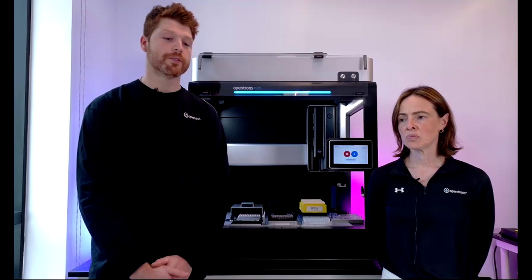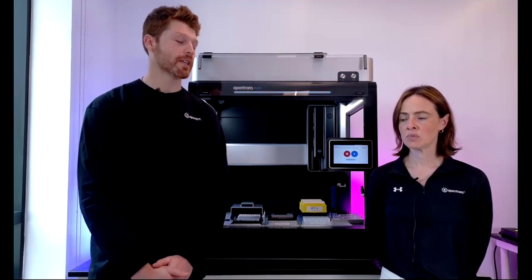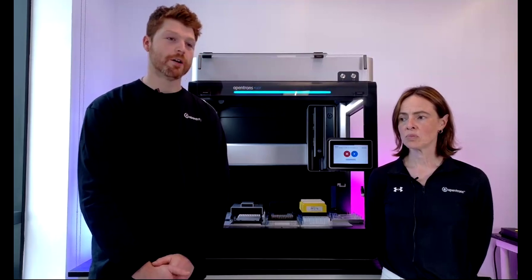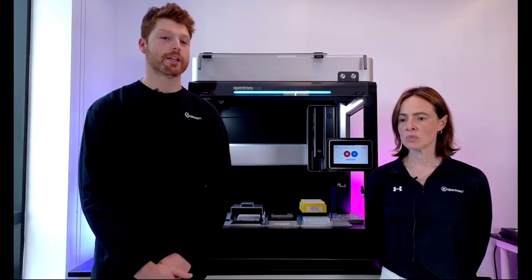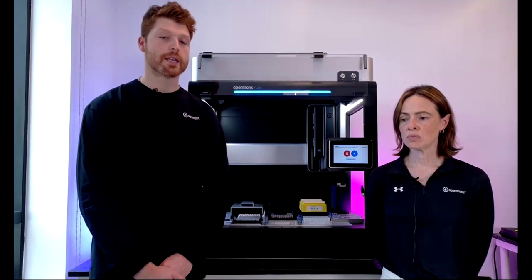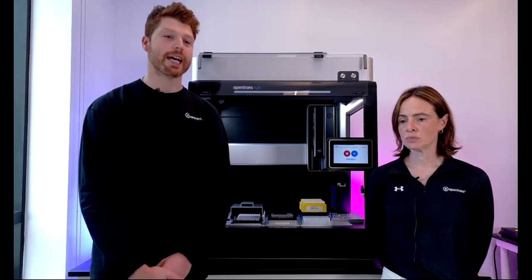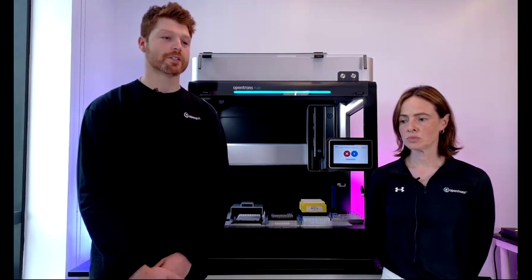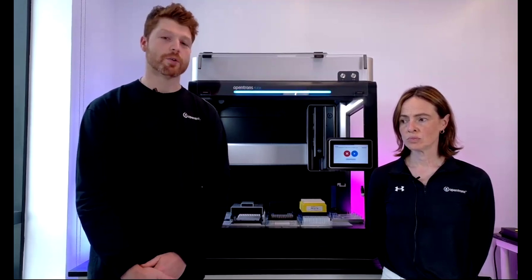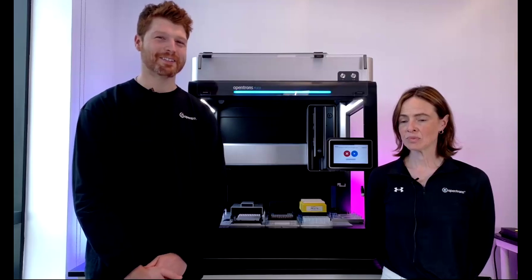As Fran was saying, I don't believe that we've done that exact use case. But definitely something that we would be willing to try out. That would probably fall into the category of having an FAS come to do some on-site protocol development and optimization, utilizing the strengths of that team and a lot of their understanding to get us a lot closer to that as a viable procedure. Probably not something that we'd find right now in the protocol library.